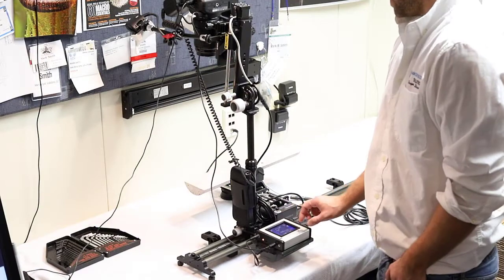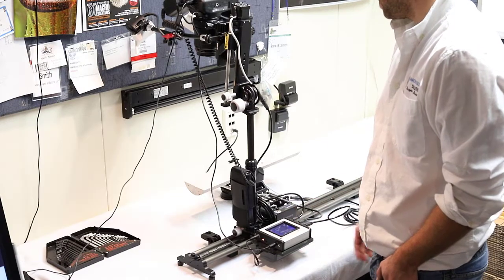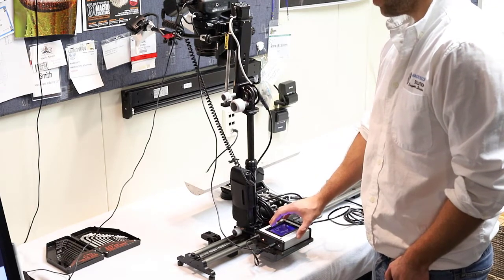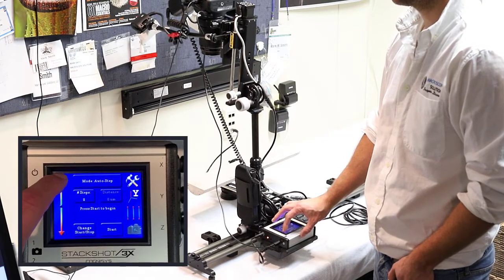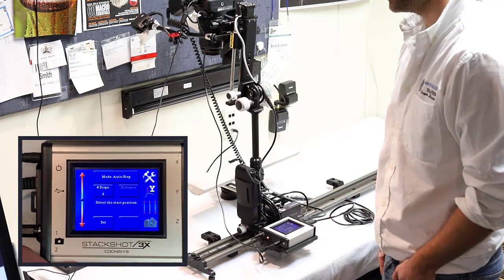So in order to do that, you'll basically go to steps here, you'll enter 8, and you'll hit your check mark. The next thing we want to do is, since we're only using the y-axis here, just navigate to the start of this core sample. We're going to hit change, start, stop, and we're going to hit set to set our start position.